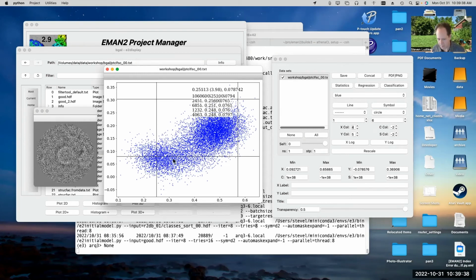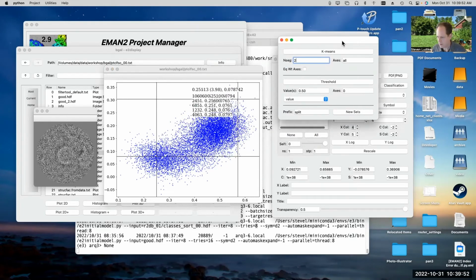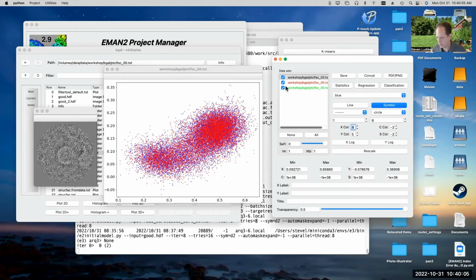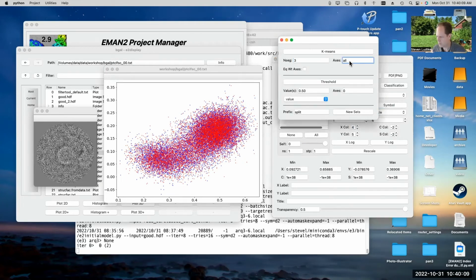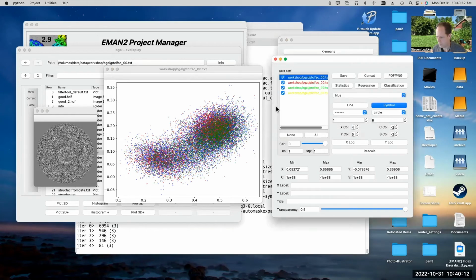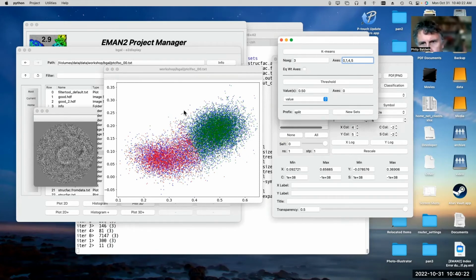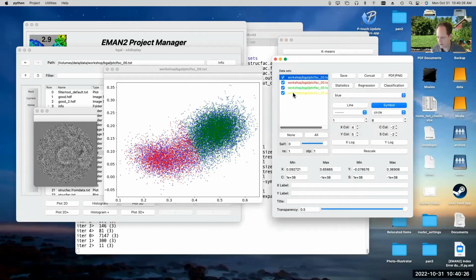So if you just run that program, it will automatically split the data up. And the way it does it, you can do it manually here. If we say classification, and we tell it to use, I don't think it actually uses all axes. We can just tell it to use all, and we say number of segments 3. Then we wind up with, oh, there we go. Now I got 3. All right, let's not use all axes. Let's just use 0, 1, and 4 and 5, because it doesn't use them all when it does it normally. So you can see how it classifies the data.